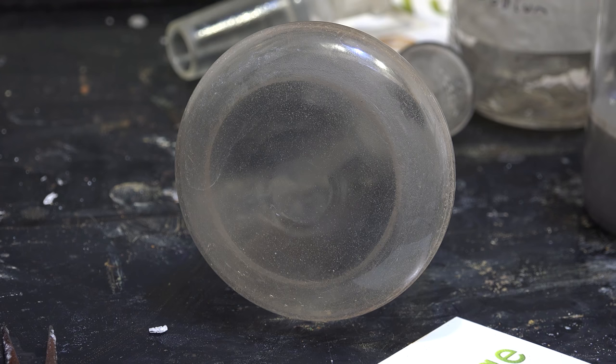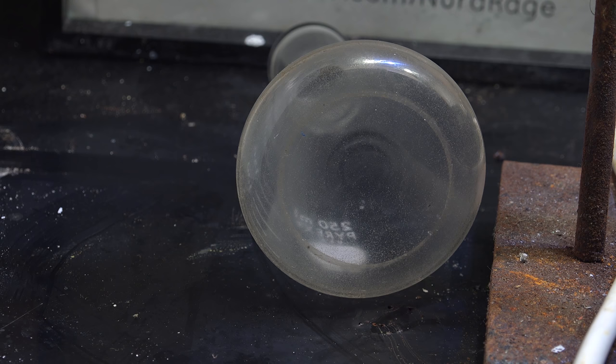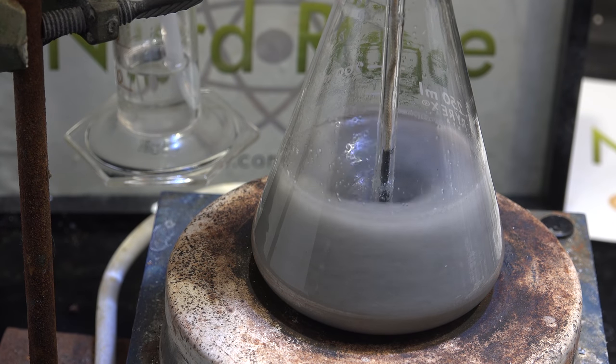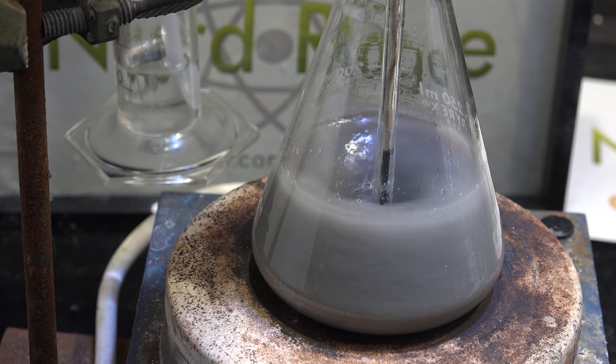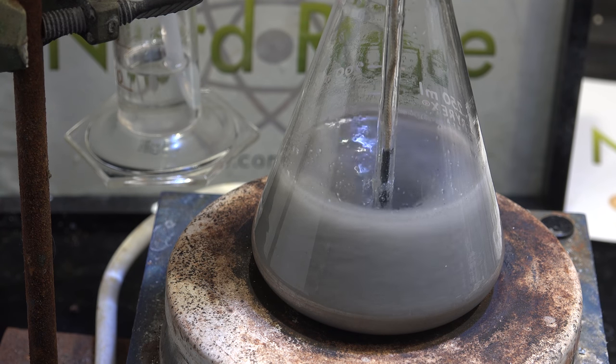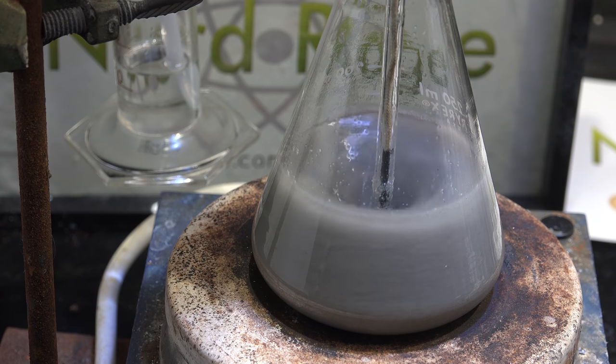And here is the cleaned flask. The damage is there compared to the previous picture but actually quite small. Maybe we can do better. I think maybe I simply ran the drying step too fast. Unlike sodium, aluminum does not liquefy at these temperatures so it would take much longer to react with water.